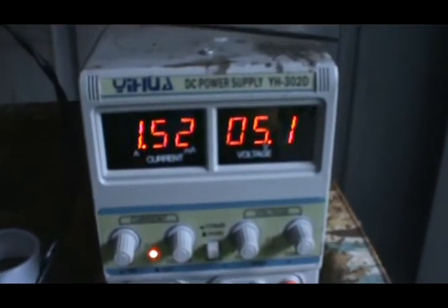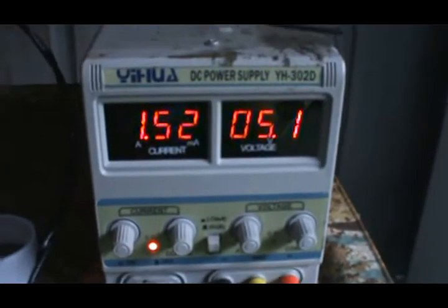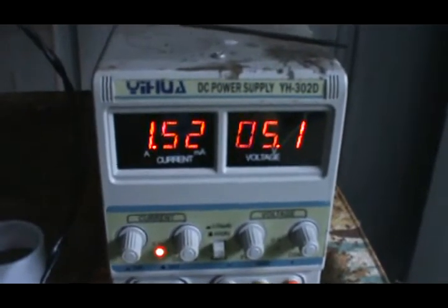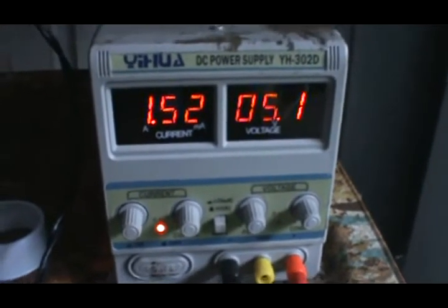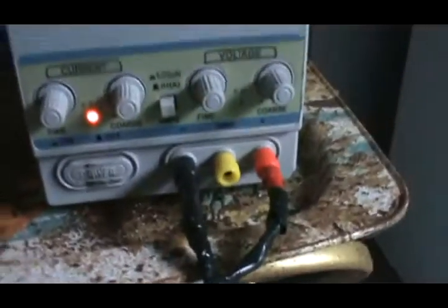I've got a DC power supply — it's 5 amp, 30 volts. Right now it's running at around 2 amps and 5 volts. I know it should be a little less voltage-wise, but I can't get the amps right so I'm going to keep it at that for now.